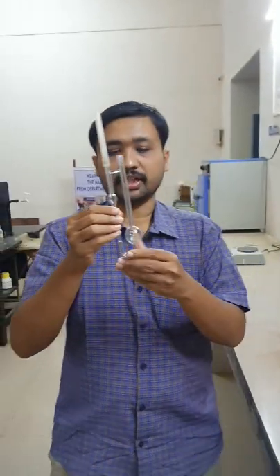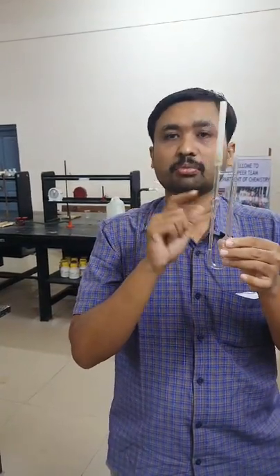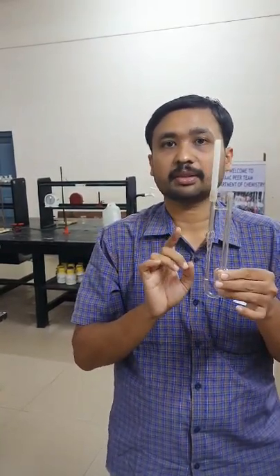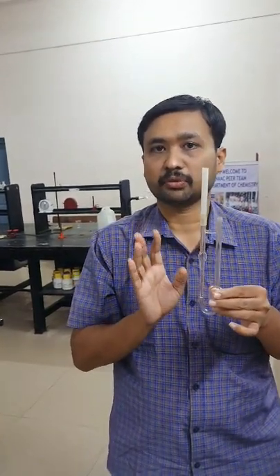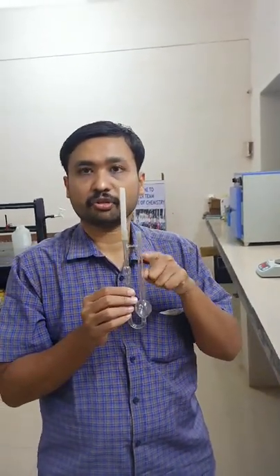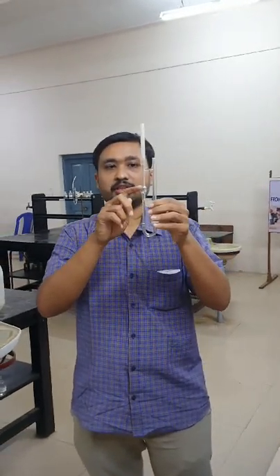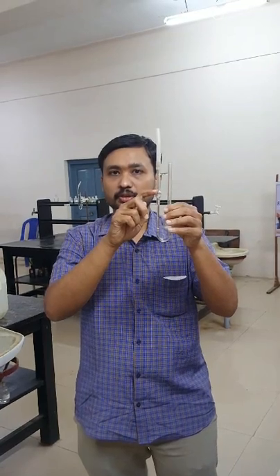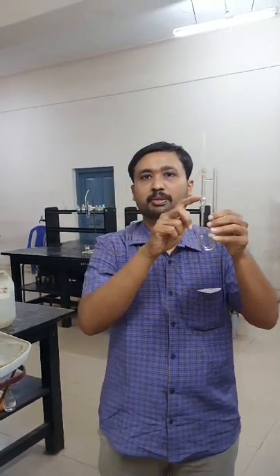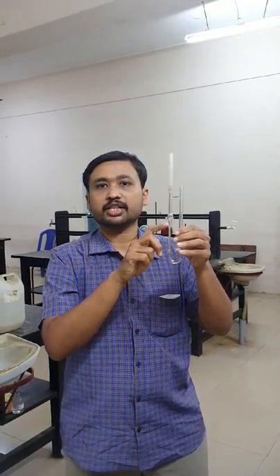Now transfer 10 ml of water into the viscometer — the same volume as used for the liquid. Suck the water through the smaller bulb; when the water level touches the upper mark, start the stopwatch, and stop it when the water level reaches the lower mark. Record the time taken for flow of water from upper mark to lower mark. Repeat the experiment at least 2 to 3 times and calculate the average value of the time of flow.